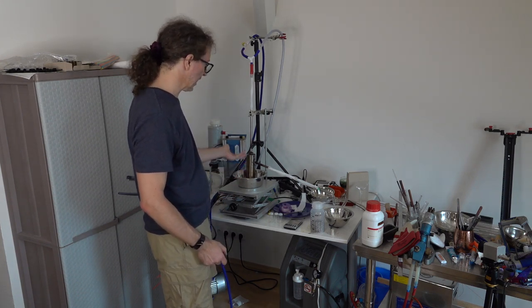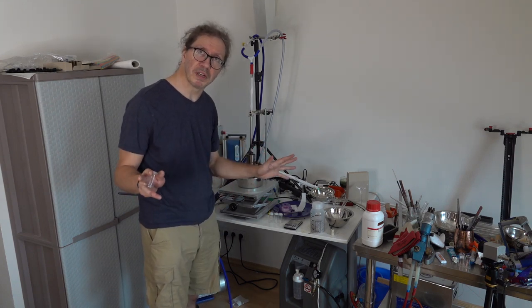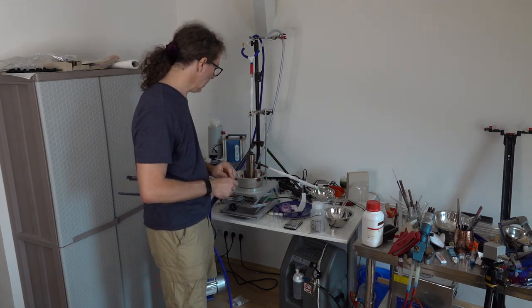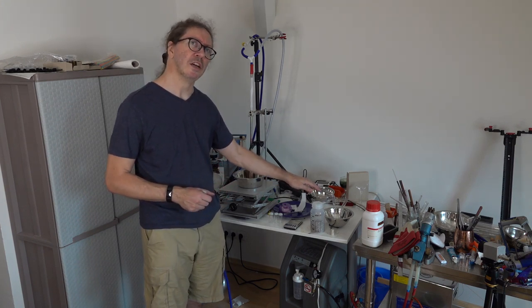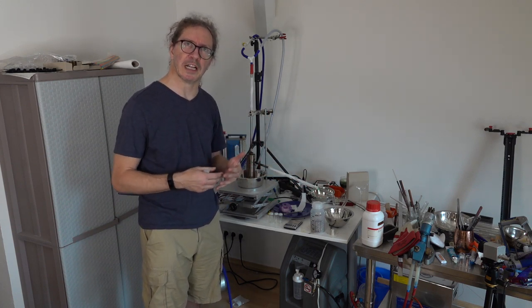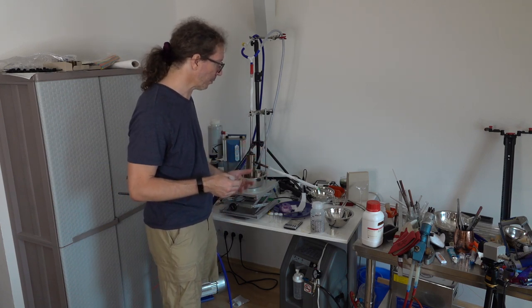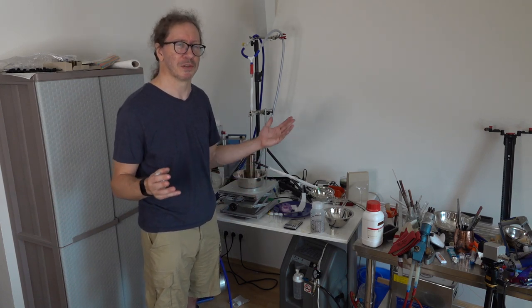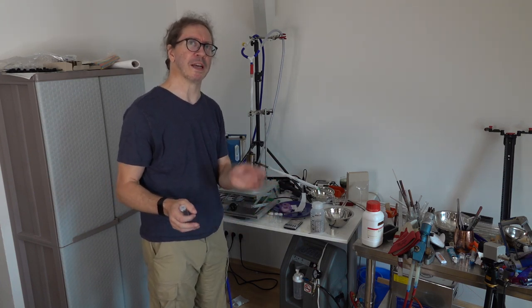I've heated the kit up under vacuum. Seems fine, no leaks. Almost certainly I'm going to get some little amounts of oxygen in here, which in practice means that the cesium is going to stick much more to the glass. When cesium is really pure, it doesn't stick to glass. This will probably stick to the glass lots, but that doesn't matter. I'm going to redistill it at some further point to make it really pure.